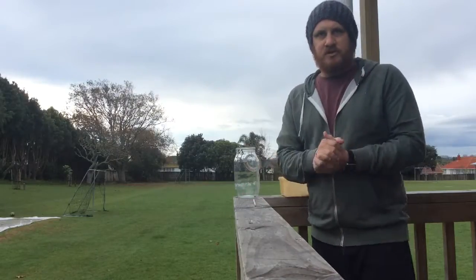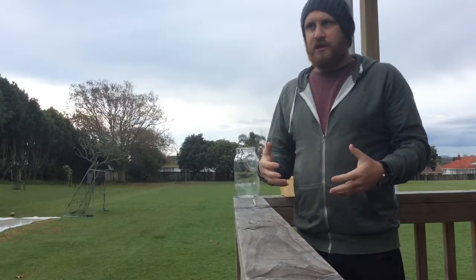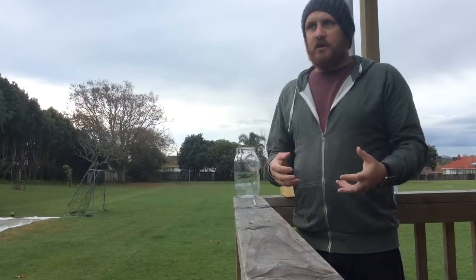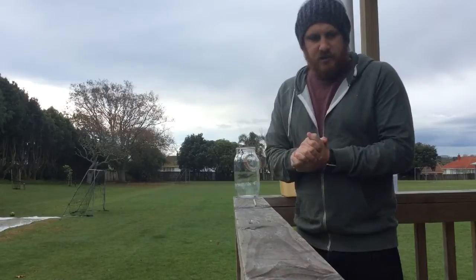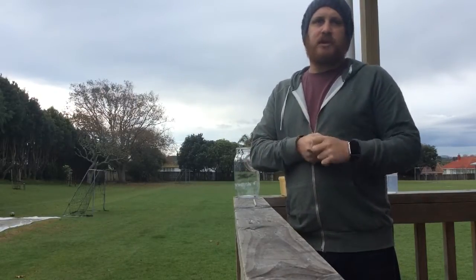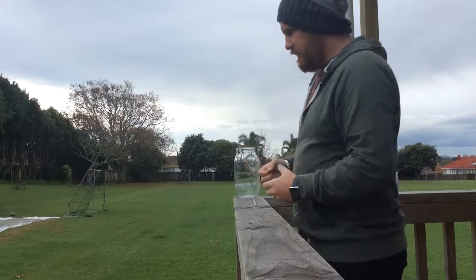This experiment, because it's exothermic and the gaseous byproduct is hydrogen gas, I'm not going to actually tell you some of the things that I put in here because I don't want you performing this at home, because I know some of you will try, even though I say adult supervision, some of you will try it without adult supervision and might get hurt.